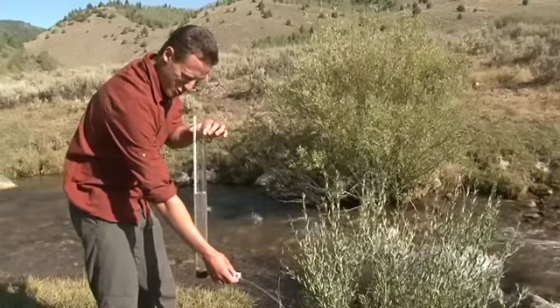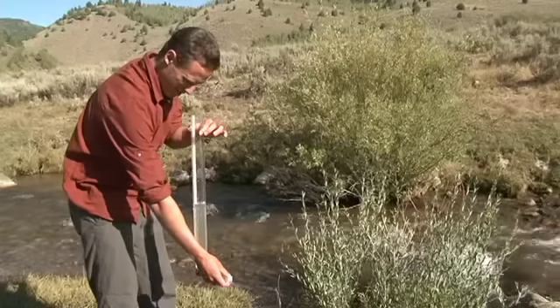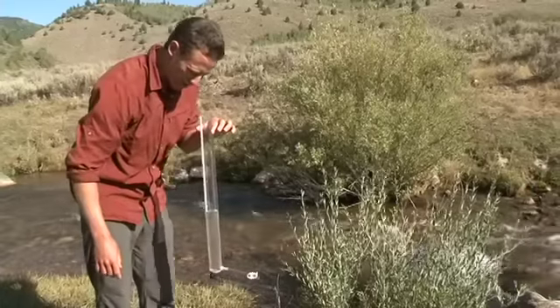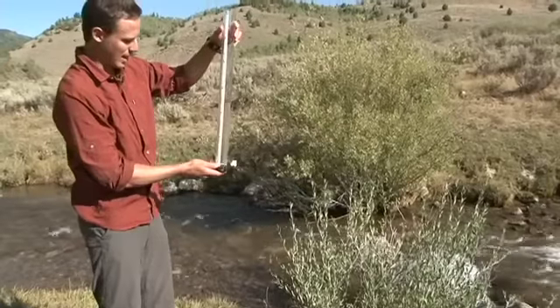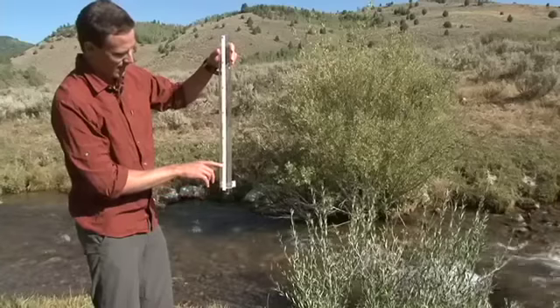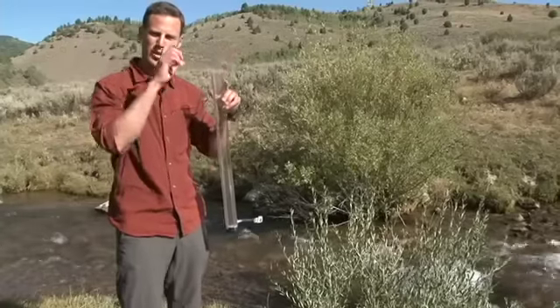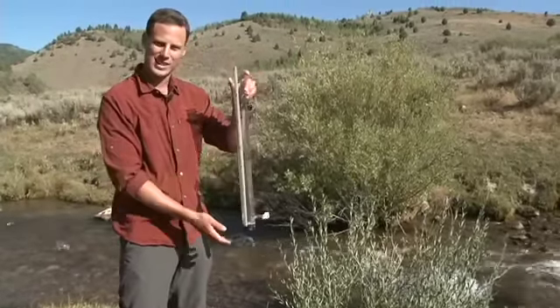You want to make sure that you do this in an even amount of light — either all sun or all shade. Now when I look down, I can just start to see the white and black outline. So then I would go on the scale and look: we have 10, 20, 25 centimeters. So this is what I would record on my datasheet — I would circle the equal sign, because it equals 25 centimeters.